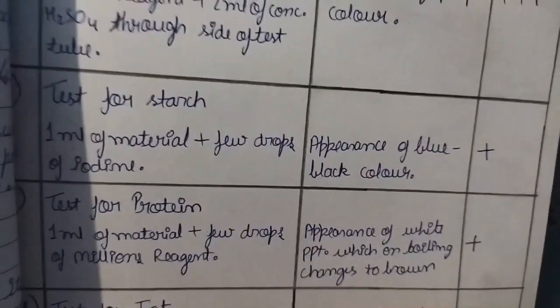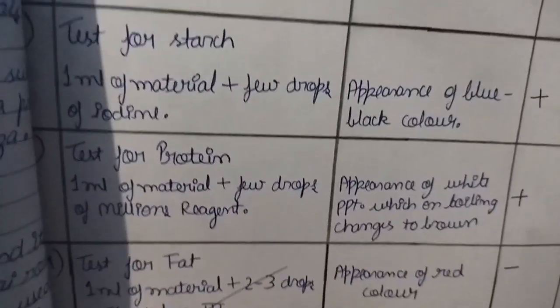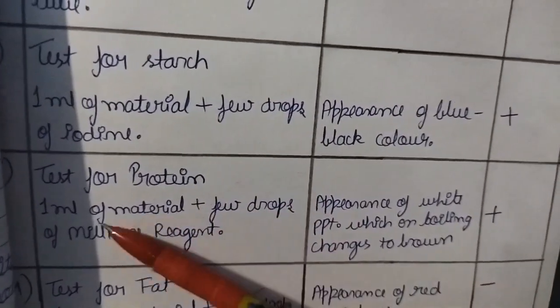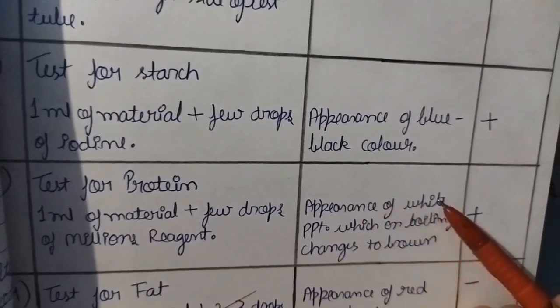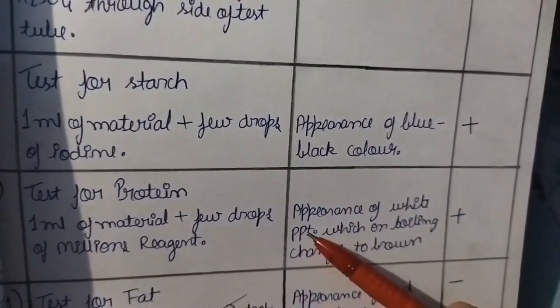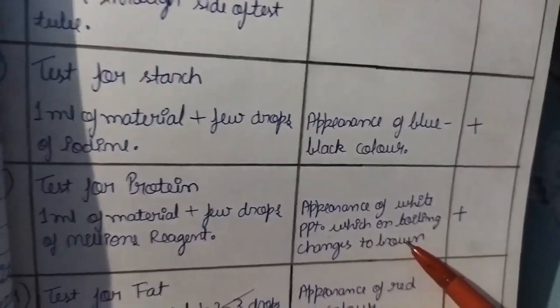For the test of protein, we take 1 ml of material and add a few drops of Millon's reagent. This results in the appearance of a white color precipitate, which on boiling will change to a brown color.